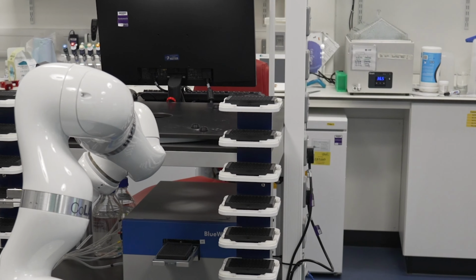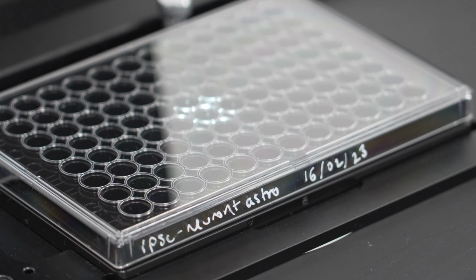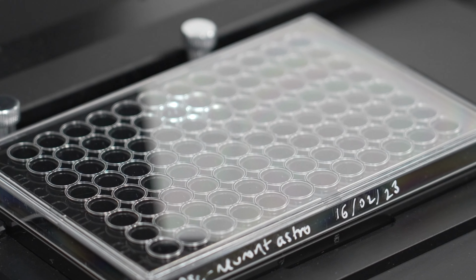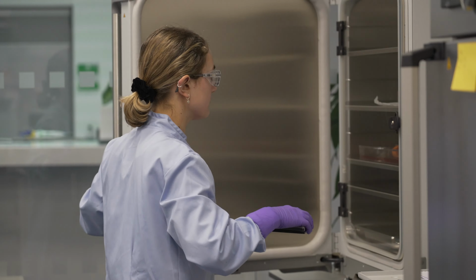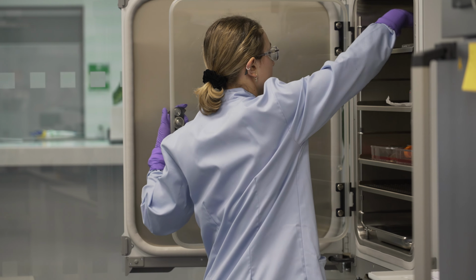We're using these types of assays together with other phenotypic outputs to help innovators understand how their drug or therapy can affect cell behaviour. Our goal is to remove barriers in CNS drug discovery through generation of predictive cell models teamed with a suite of innovative assays.